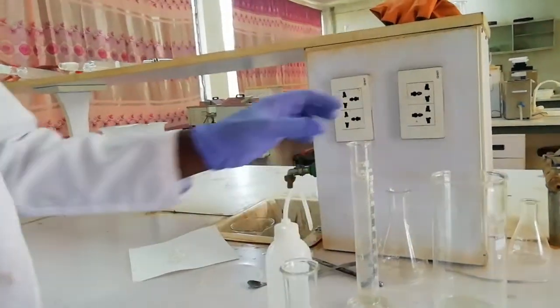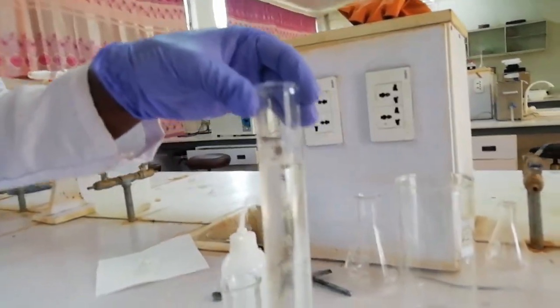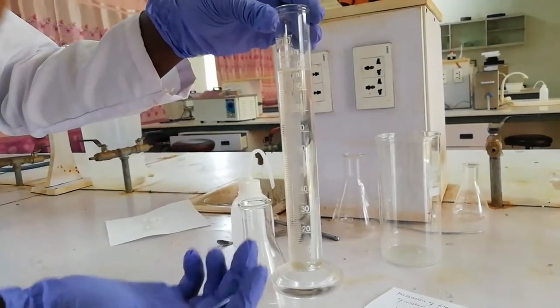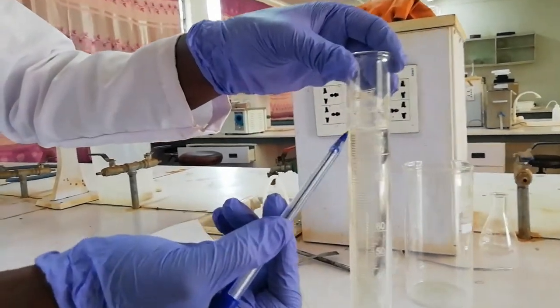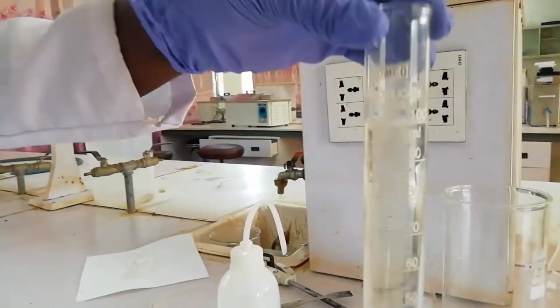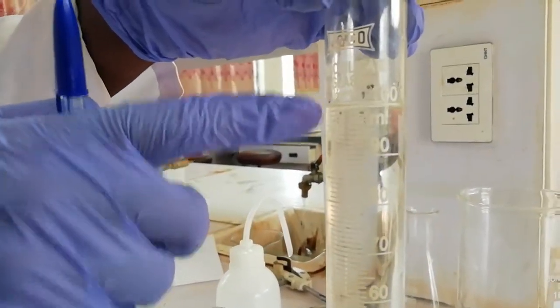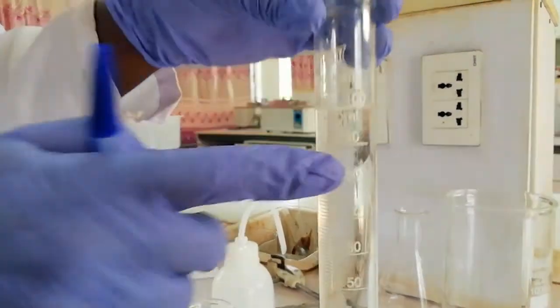This is a graduated measuring cylinder. We use it to measure the volume of liquid. Now I have 100 mL of water. This is our volume of solution — 100 mL.